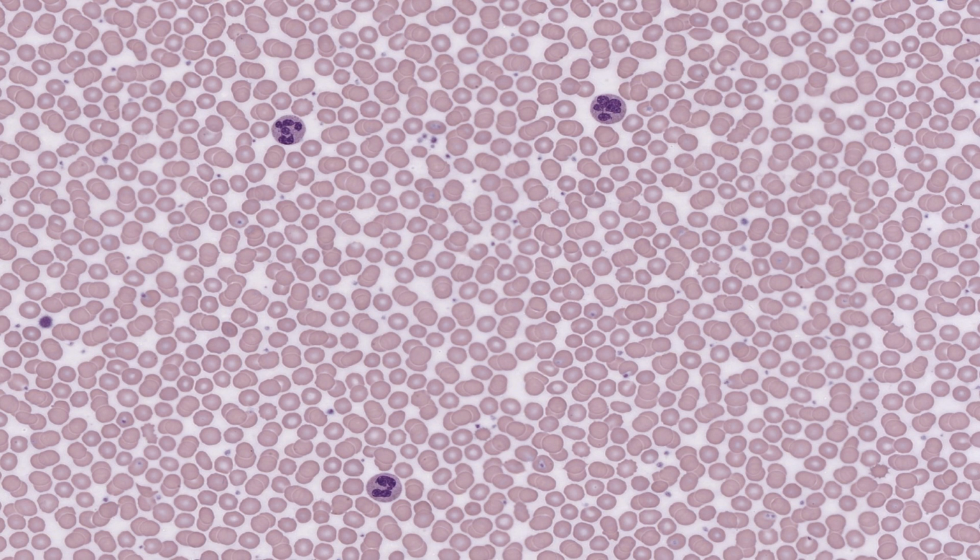If there is a great demand for neutrophils, such as from an infection, cells may be released before their nuclei have been fully developed. These cells with incomplete nuclear lobes are called band cells or stab cells, and their presence in significant quantities is an important diagnostic of disease. Their cytoplasm and granules resemble those of mature neutrophils. And I'll point out one of these band cells or stab cells when I talk about bone marrow cells in a later lecture.